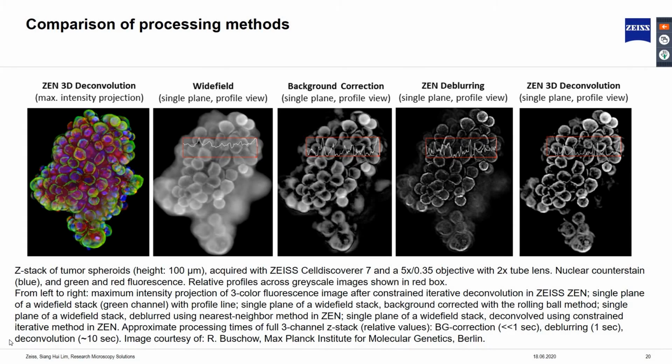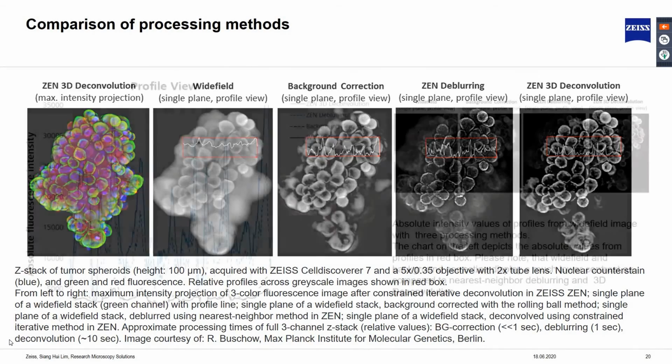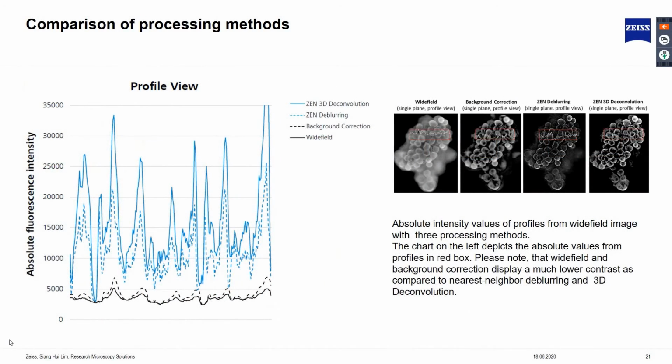The red box in each image depicts the intensity profile across the region. When we extract this profile and compare this value in absolute intensity, as shown in the chart here, the intensity profiles from widefield and background subtraction display a much lower contrast when compared to the profiles from nearest neighbor deconvolution and 3D deconvolution dataset. The high contrast obtainable in deconvolution datasets is due to the ability to reassign photons back to their origin.